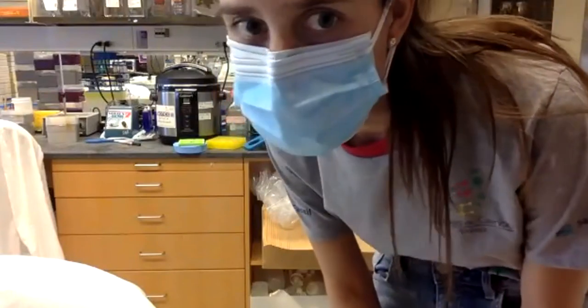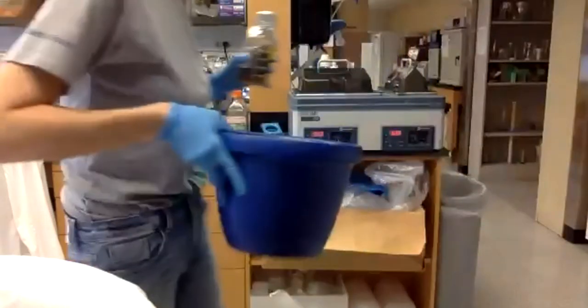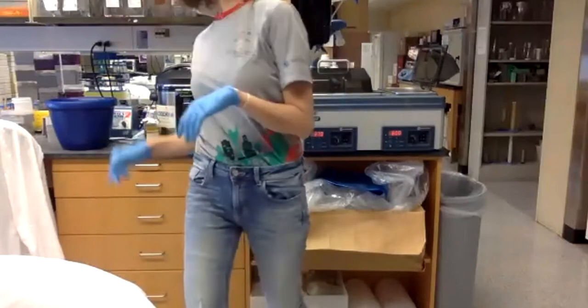I will bring the bacteria, so just hanging there. Okay. I will bring the protocol.